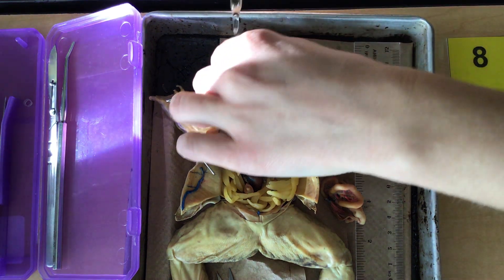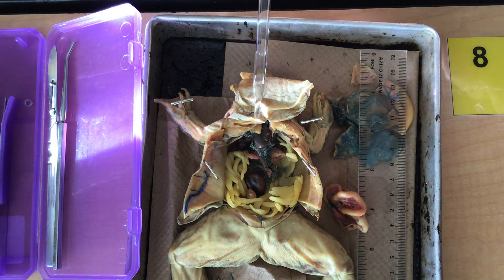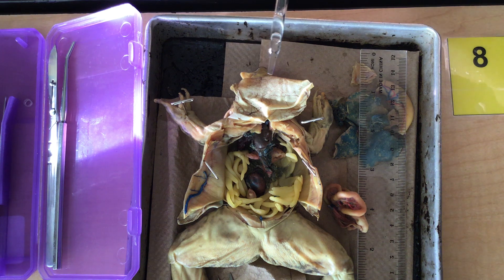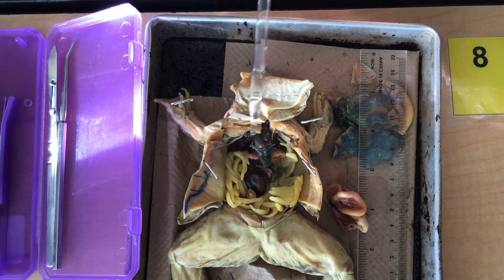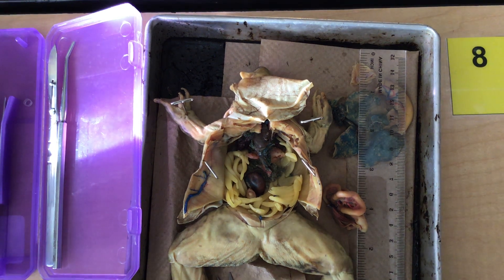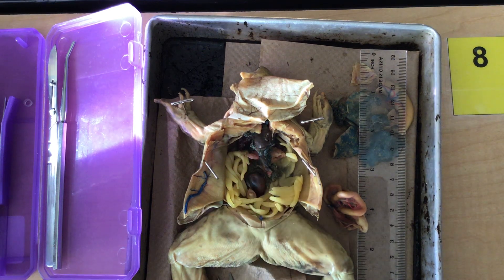So if I go back into my frog's mouth, which should be open — one issue, though: you're going to try and put this all the way at the back to that opening to inflate your lungs. One issue with my frog: this was a new frog, so his mouth is not open. Go ahead and give that a shot and see if you can get that to work. And then think about how the respiratory system interacts with the circulatory system.